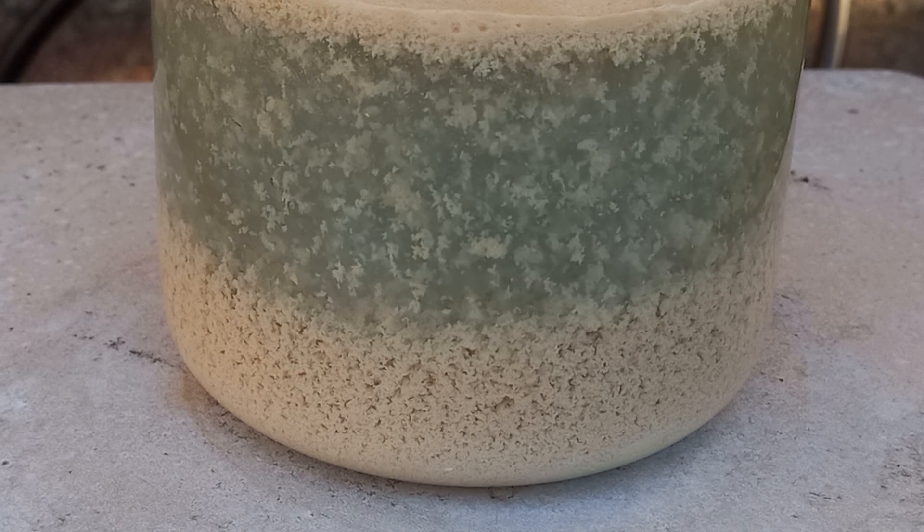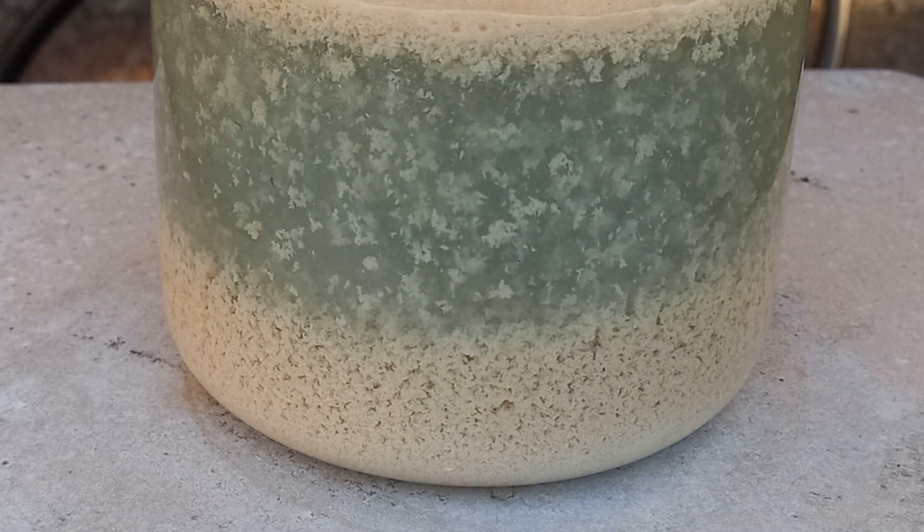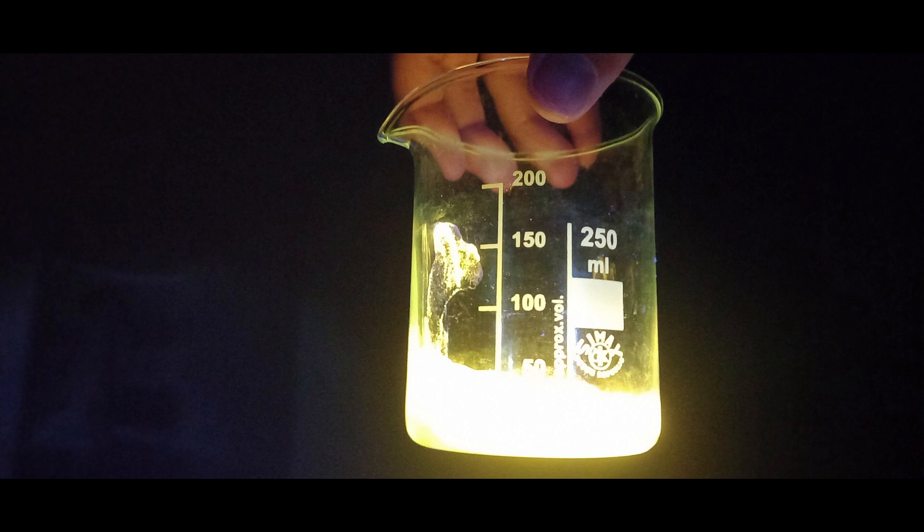I was really curious, so I got my UV flashlight and let's test it. Oh yes — it worked! Pretty cool stuff. It's just like a slight white water normally, but under UV — let's go! Very nice.